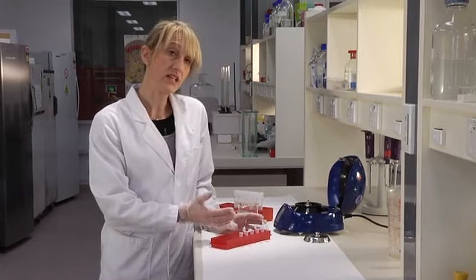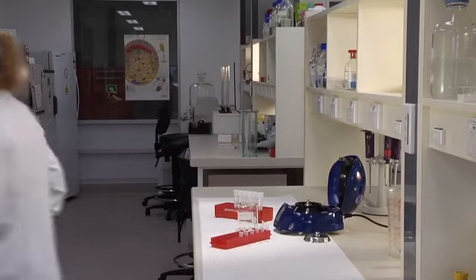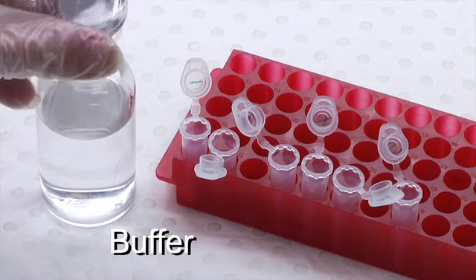And then, because ethanol can interfere with later steps, we'll just leave them to dry. Once the pellets are dry, we re-suspend our purified plasmid in a small volume of buffer.